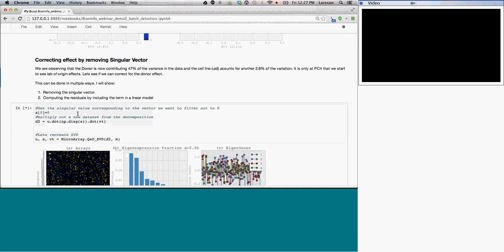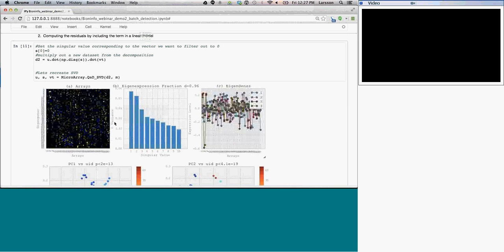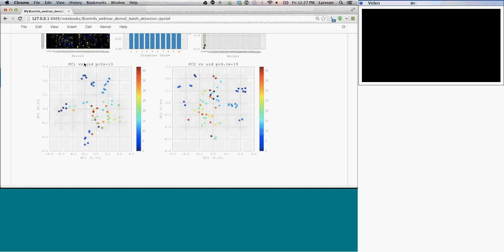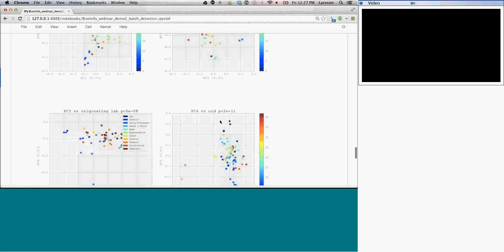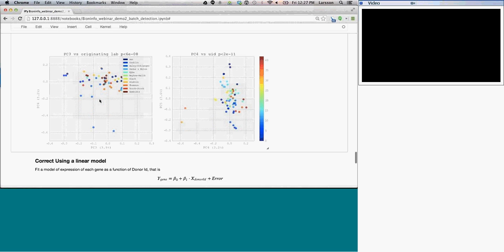Wait for that to execute, and we'll get the same figure. What you'll notice, though, is that there's been a drastic change in the distribution of singular vectors. And if we look at the PC plots, we now see that PC1 is associated with UID, which is the cell line, which is good because we have repeated runs here. Second one is also associated with this. And third one is now originating lab. So more or less what happened is that the second PC moved into the first place, third PC moved into the second place, etc. But what we see here is now we have a data set that is stripped of this.